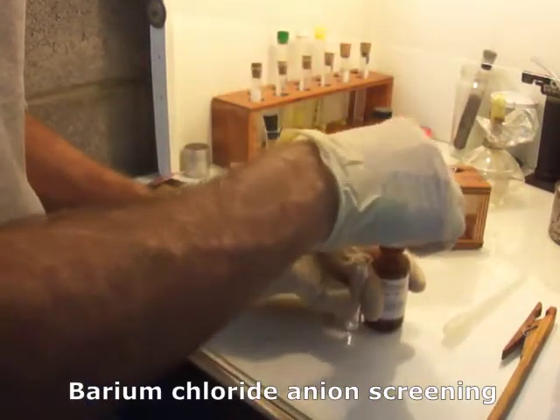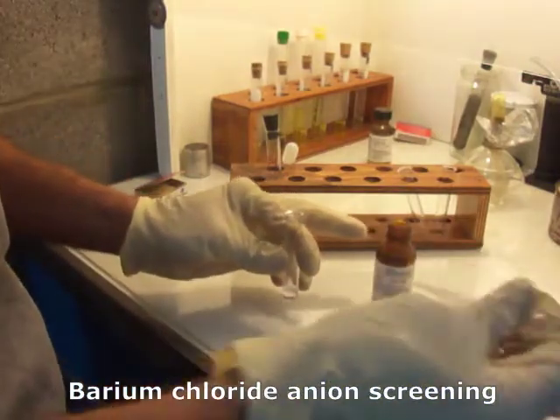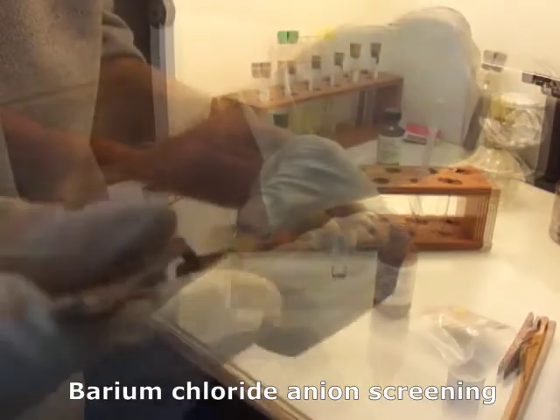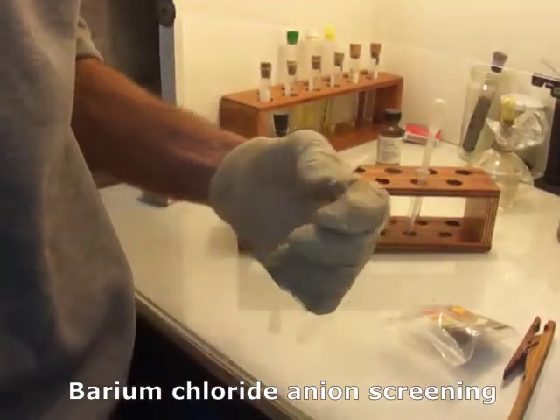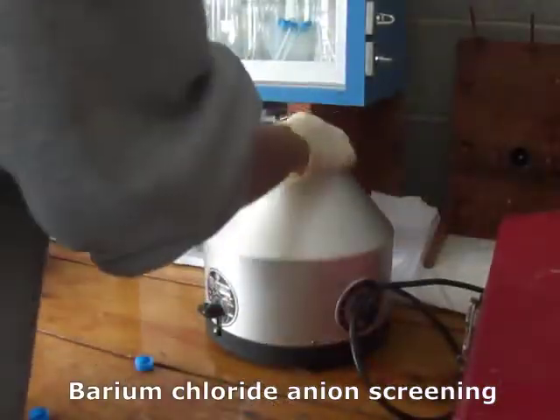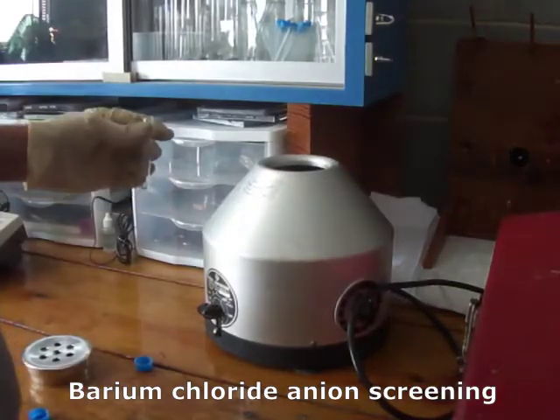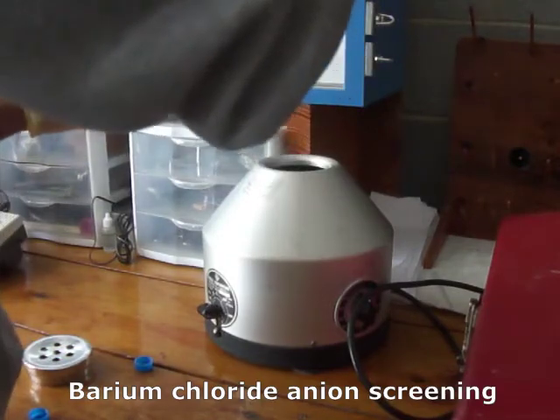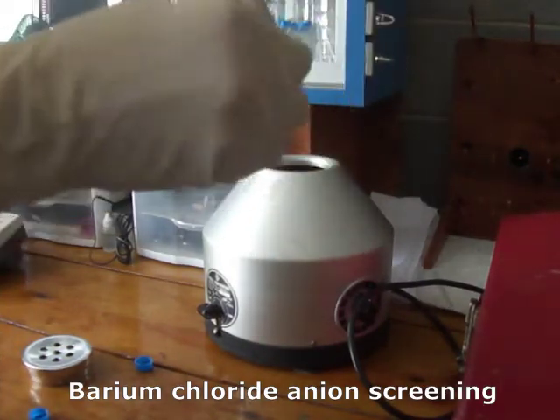Now we make it slightly alkaline with ammonium hydroxide. All right, that's definitely basic. So here we centrifuge and discard the precipitate. We just keep the solution.